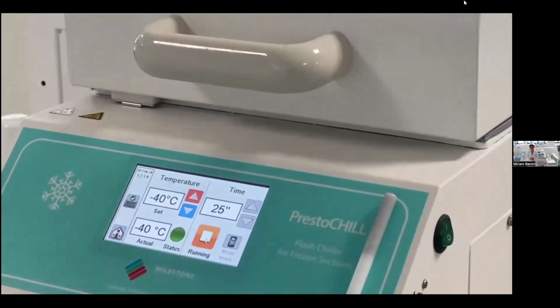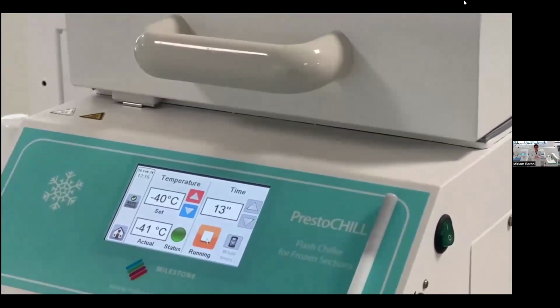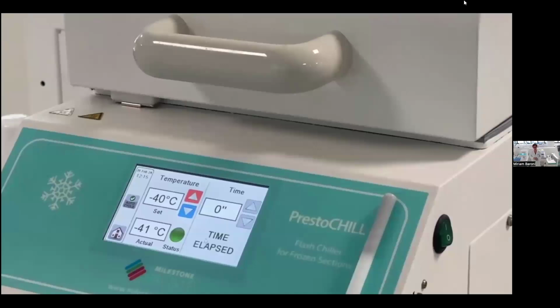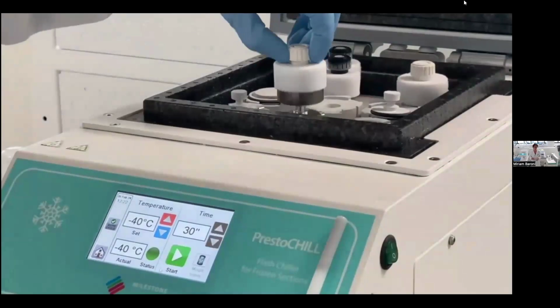But how does the freezing in the PrestoChill work? The direct contact between the sample and the cold metal at -40 degrees allows a freezing that is so fast that the water inside the tissue passes from 0 to -5 degrees in such a short time that the water has no time to create ice crystals. It freezes in a vitreous way that is not larger than the liquid status.